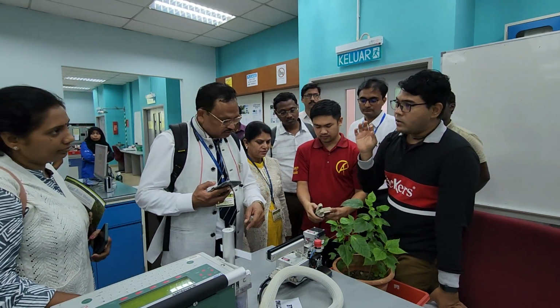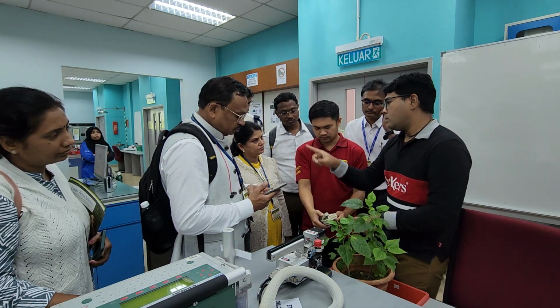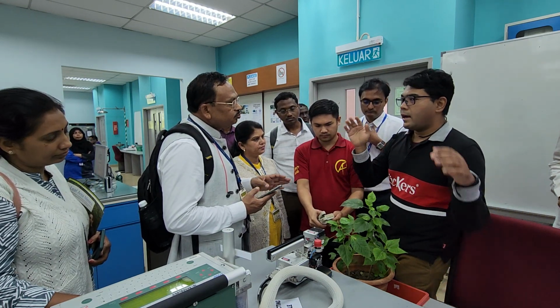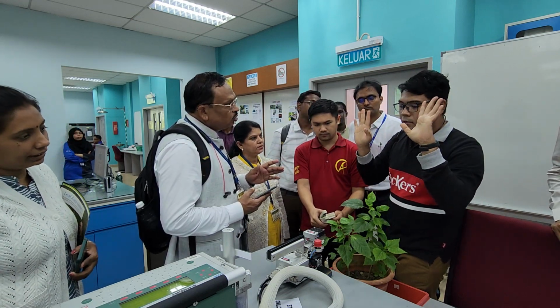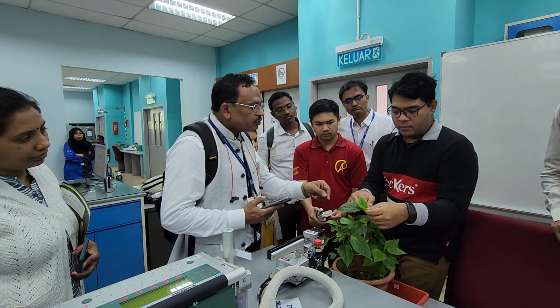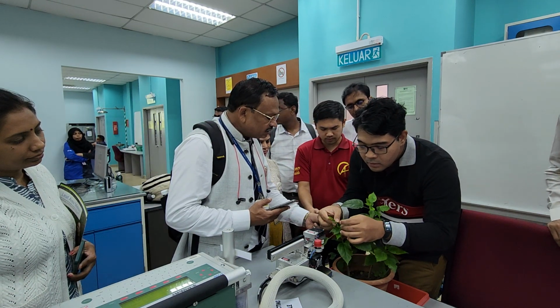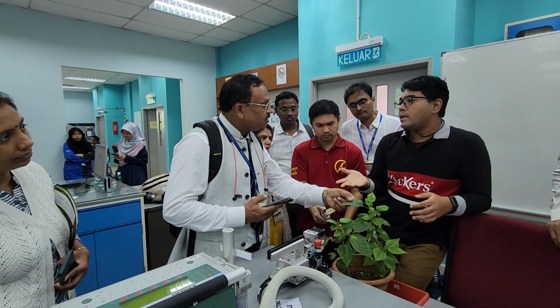Whatever reading that you are taking from the plant, with a spectrometer, photosynthesis, or any equipment, always use a fully expanded leaf. A leaf that has achieved its full physical maturity, not age, physical maturity. For example, like this leaf here. This is from the shoot. Is it the top shoot here? Mainly the selection is mature leaves. Yeah, that depends.